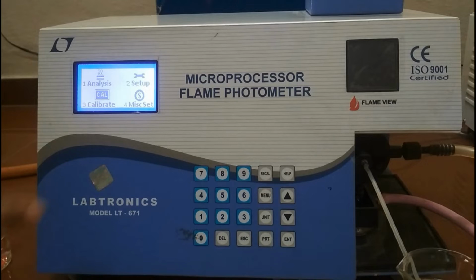This is the first necessary step before any calibration or analysis is performed. The instrument can store up to 10 different setups at any point of time. Creating a setup is like creating different files in which one can specify different parameters like number of elements, their standard values, etc. Once a setup is created, it can be used for calibration followed by analysis.